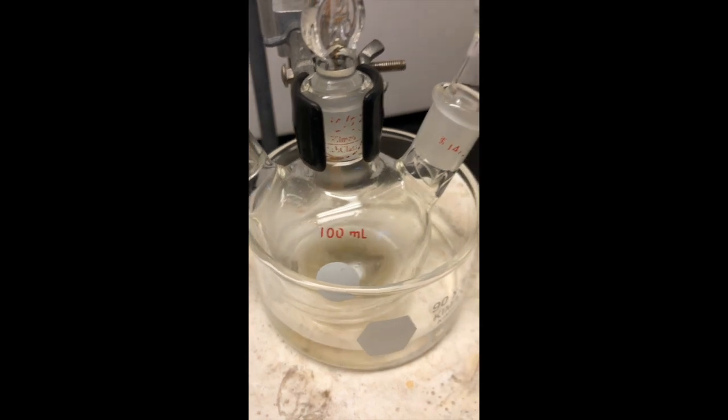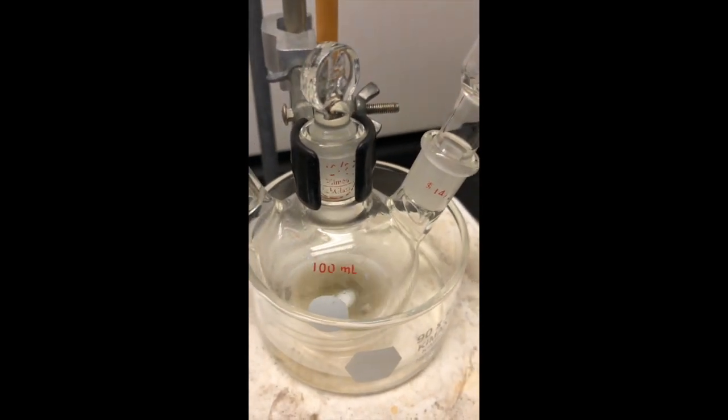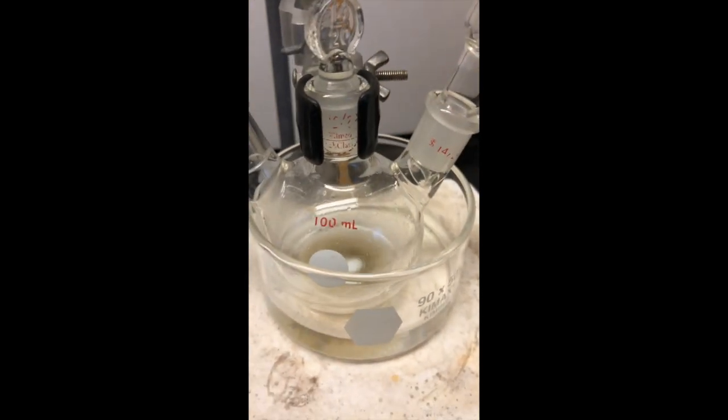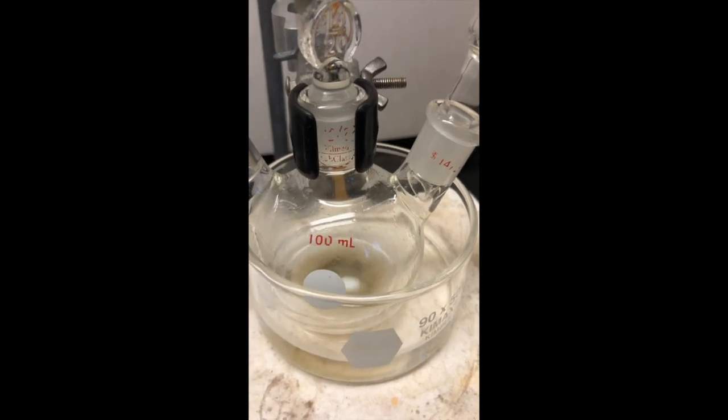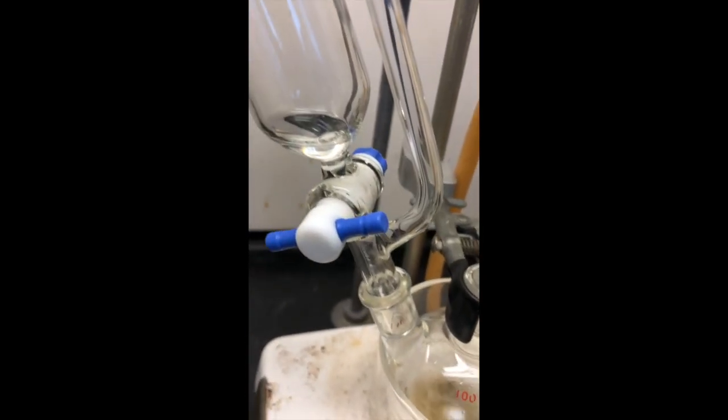It's going well on its own today, which is great. It's reacting. We're very lucky, and we'll see if that keeps going on its own before we continue adding the rest of the bromobenzene.